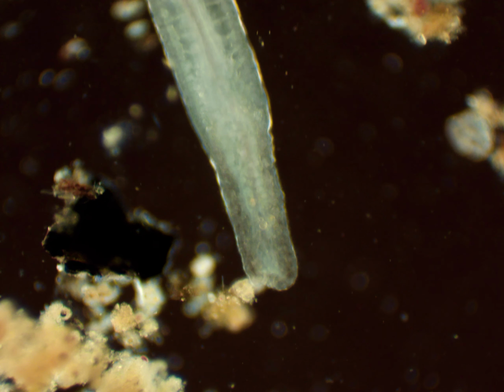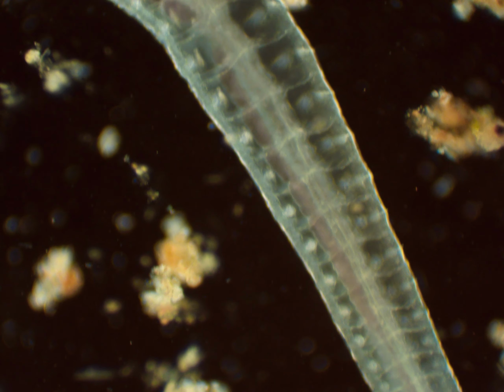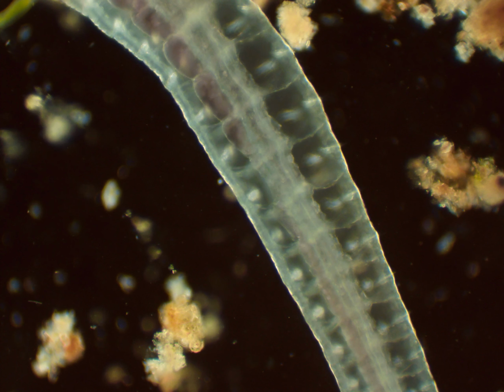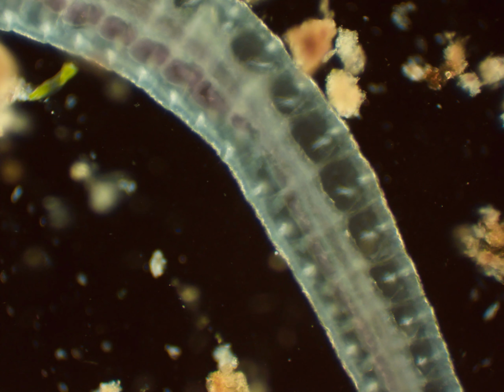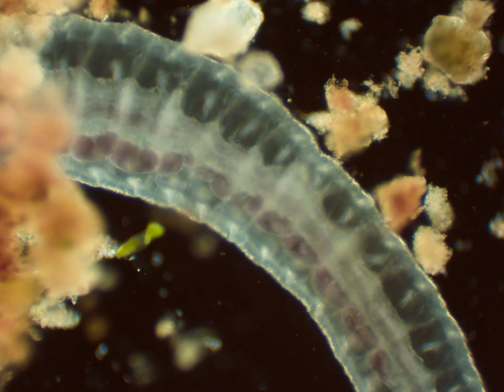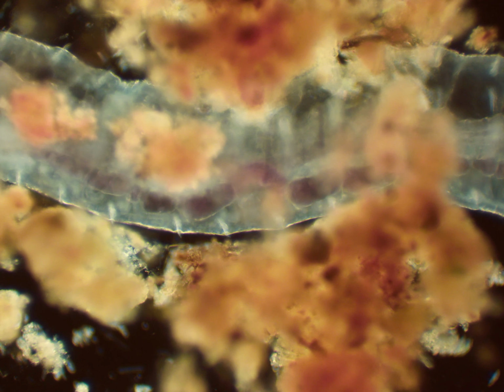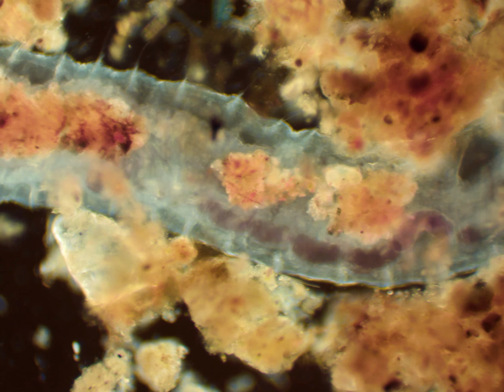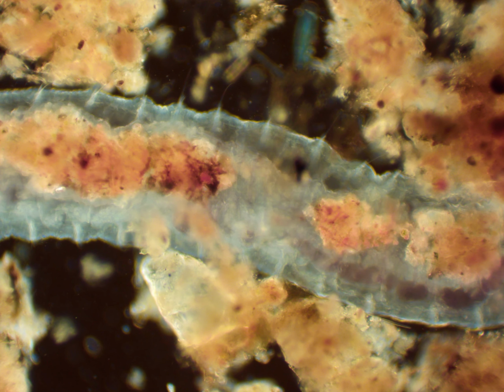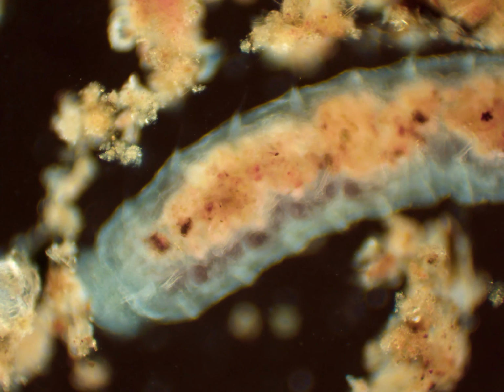Here you can see that, which I believe is a bunch of fluid building up, which comes from its different muscles moving, or fluid from the digestive system that is waiting to be excreted. I don't know, but here you can see muscles moving. So each segment appears to have two of those muscles contracting, which is what's moving the worm. So all of its segments have those two muscles, and they're all corresponding.